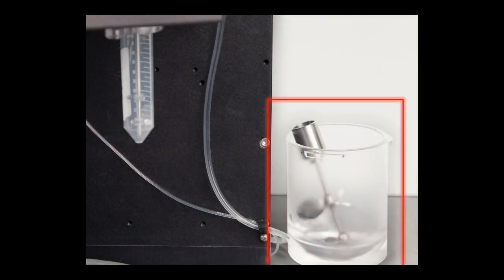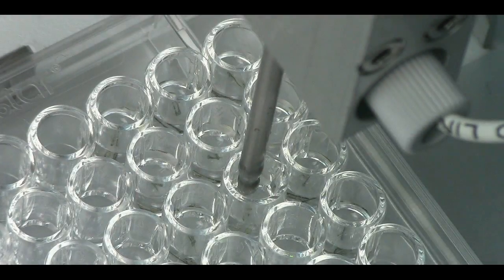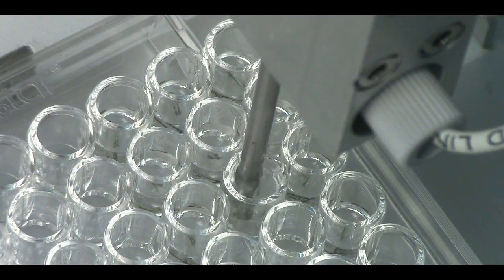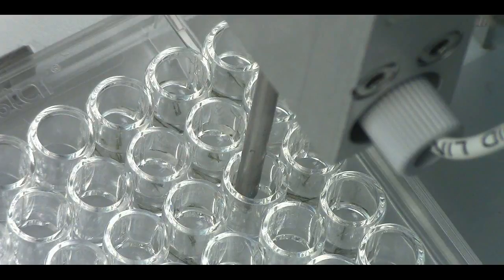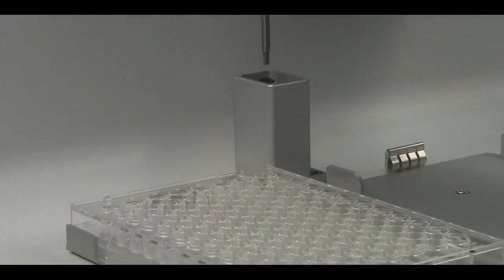A 50 ml, 750 ml, or 1.5 liter sample cup can be used to contain your sample, and up to 3 lasers can be configured depending on the fluorophores to be analyzed. Use of Union Biometrica's large particle sampler may be employed to draw sample from a multi-well plate or petri dish and transfer them to the COPAS FP system for acquisition and analysis.